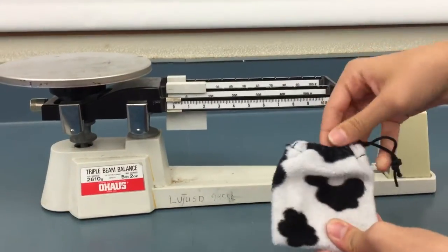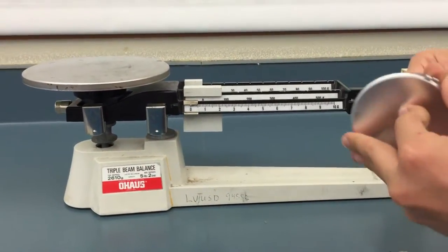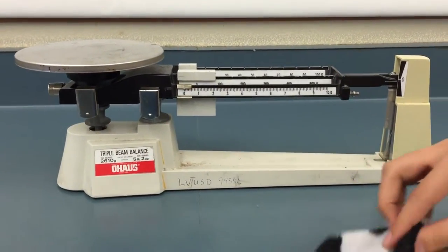So I'm going to be measuring this little pouch. It just has a little compact mirror in it.